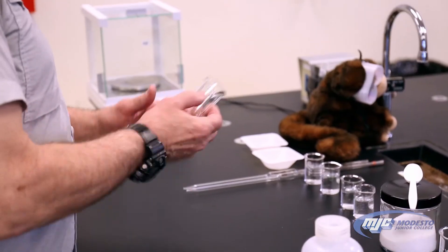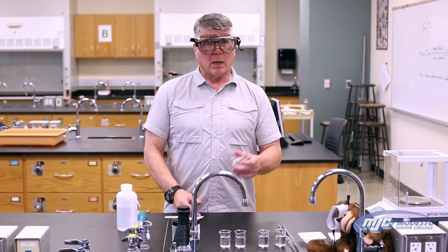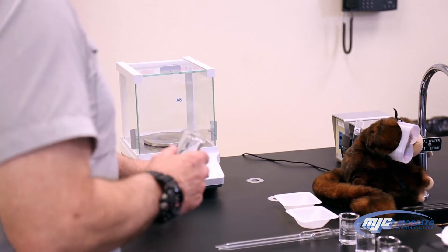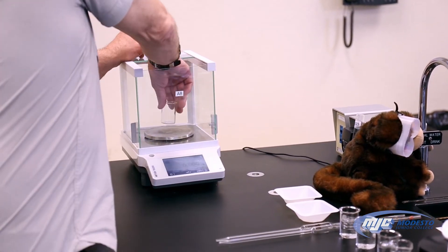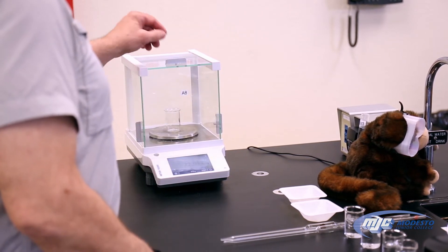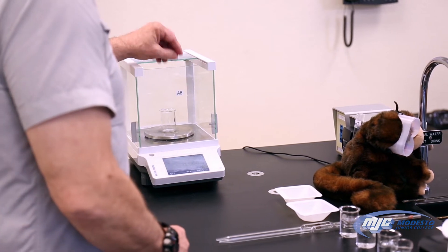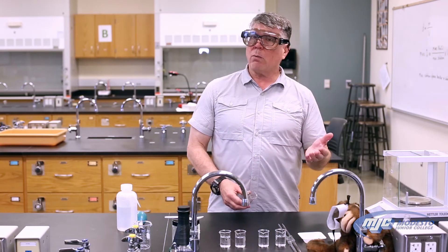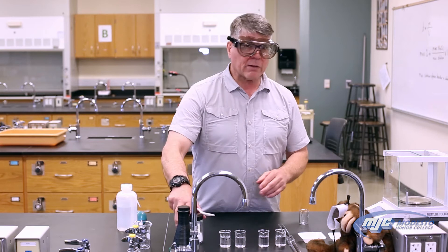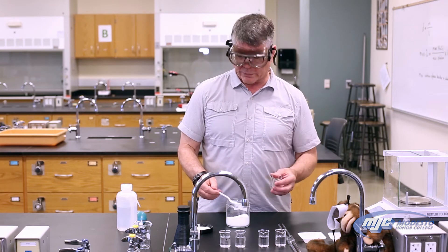So we're going to take our 30 milliliter beakers, label them one, two, three, four, and five so we know which is which. Starting with beaker one, first we need to know the mass of the empty beaker. So we make sure the balance is zeroed, place the empty beaker on there, and record that number in your data table — three places past the decimal, grams are the unit. Then we tare out that beaker. Now it says zero with the empty beaker on there. In beaker one we're going to put about one gram of sodium chloride, beaker two about two grams, then three, four, and five grams. It doesn't have to be exactly one gram — it's a waste of time to try to get exactly 1.000 grams; just as long as you know how much it is and it's roughly in the neighborhood, we'll be good.